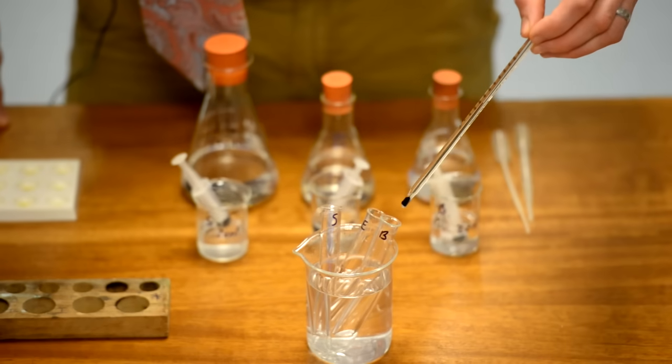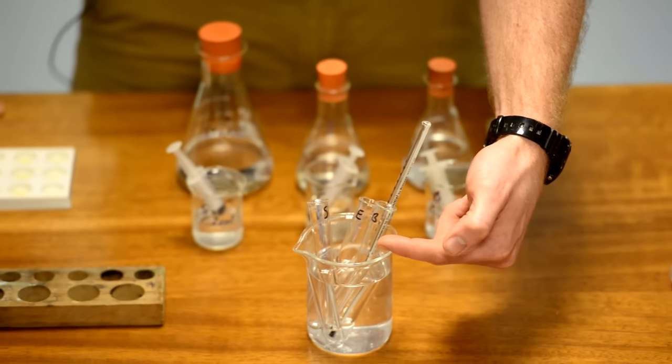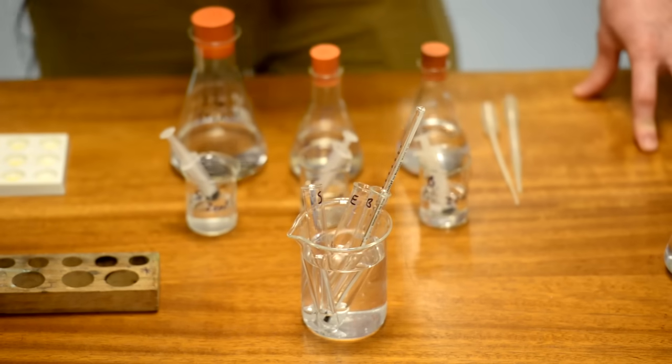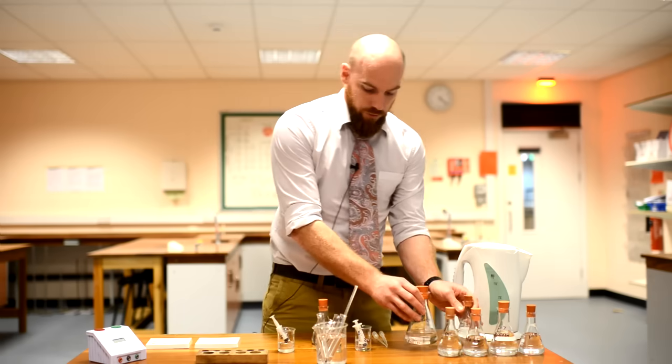It would also be wise to measure the temperature from inside one of the tubes rather than of the water that the tubes are in, because then you're actually measuring the temperature of the solutions that you're going to test. Then you can put these to one side for a minute.